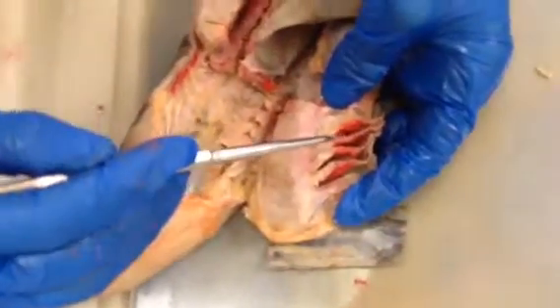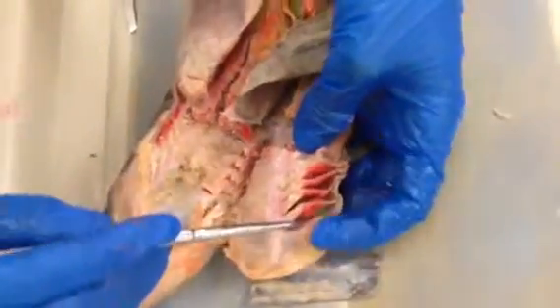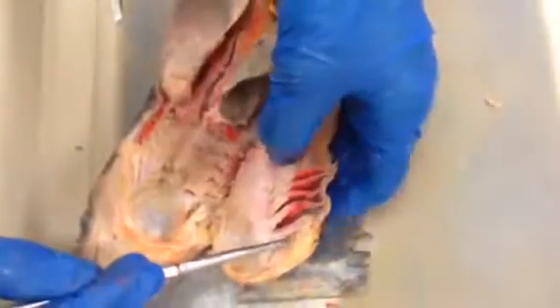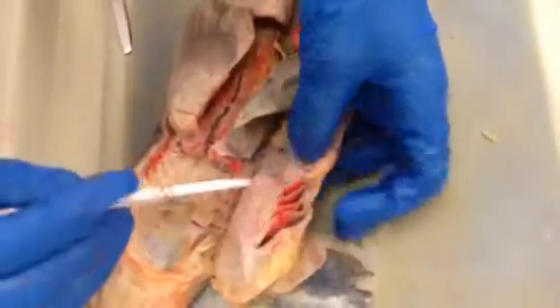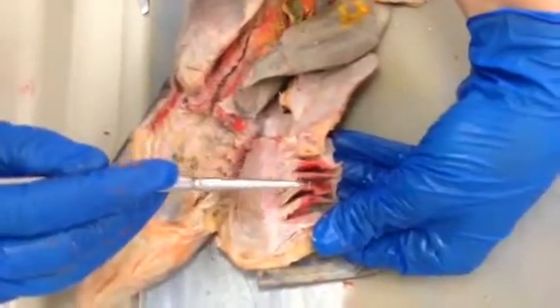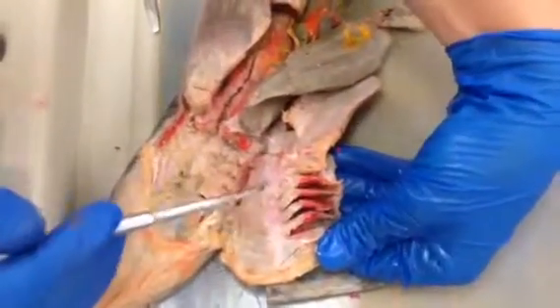These are called holobranch gills because each gill is whole, having them on both sides. On the first gill, like this one, you can see it has gill lamellae just on this one side, and of course there's nothing over here, but there's no chamber on that side. This is called a hemibranch gill. Similarly, the last one is the same way. The sixth one is a hemibranch, and then these 1, 2, 3, 4 are all holobranch gills.